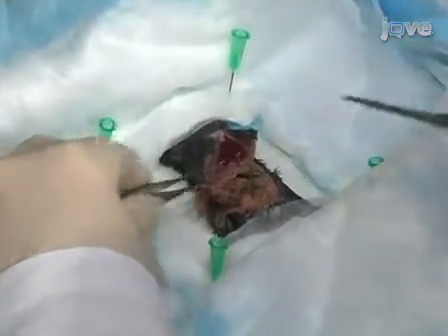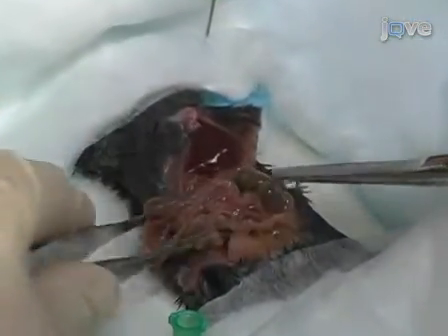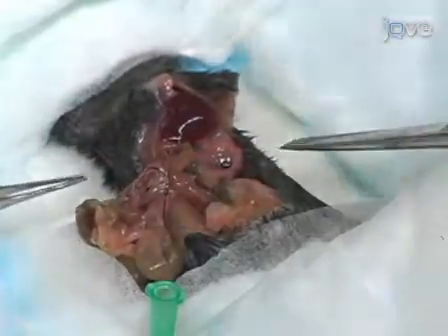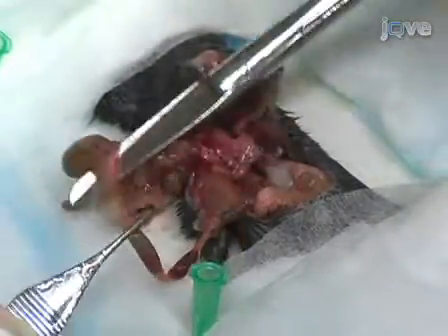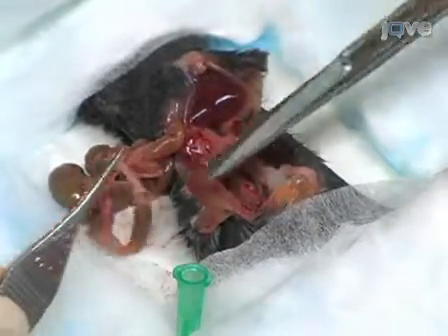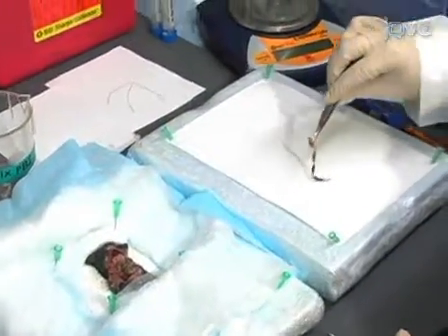Identify the small intestine, cecum, and colon. Carefully dissect and tease the colon from the surrounding mesentery. Transect the colon deep in the pelvis to free the distal colon from the rectum. Care should be taken so that no arteries or veins are cut. Also be aware that the colon can tear easily, so gently remove the colon from the mesentery. Transect the colon at the ileocecal margin to free the proximal colon. Remove the colon in total.